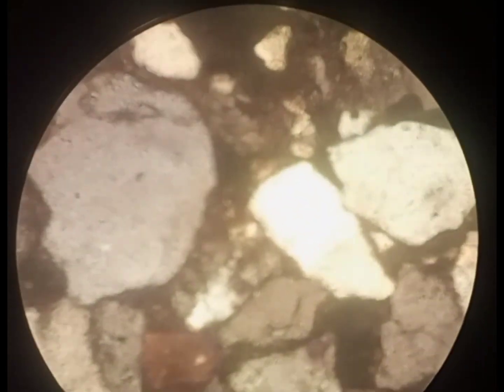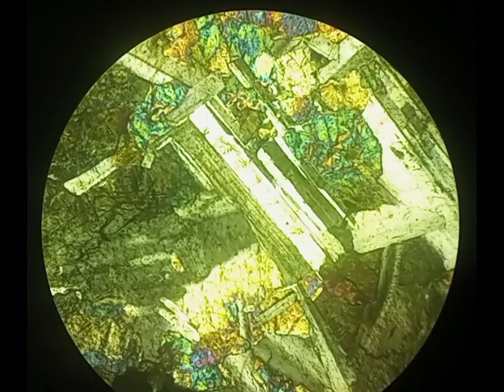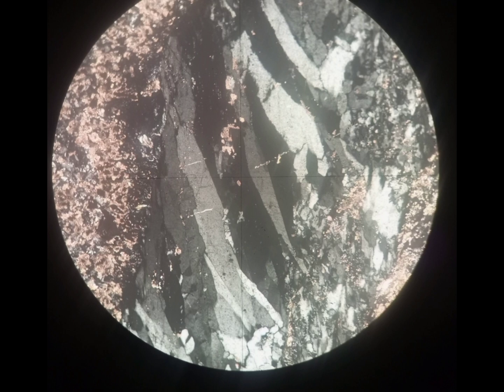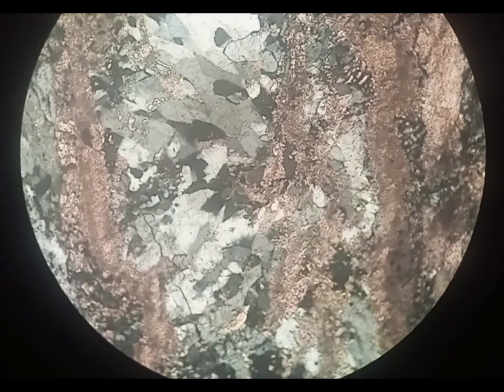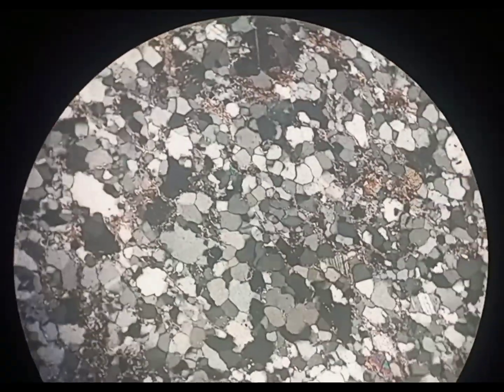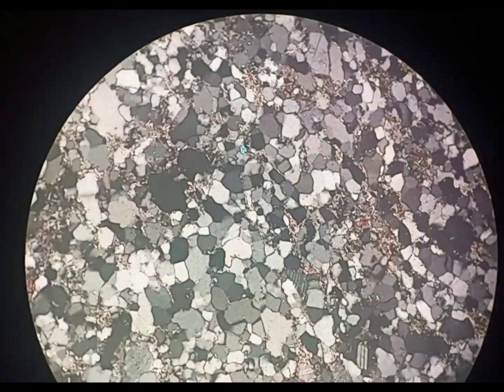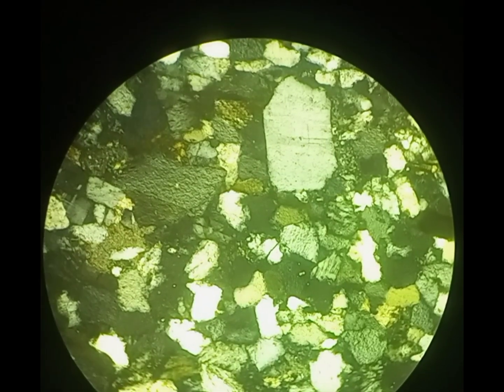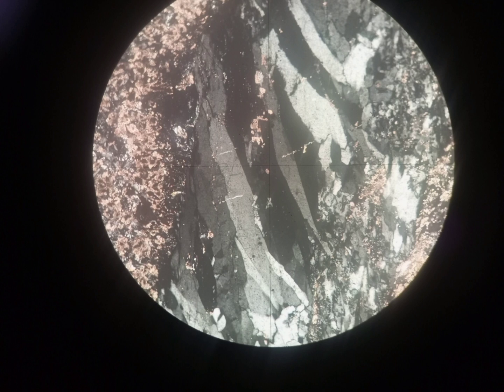Quartz grains are mostly found in anhedral to subhedral crystal shapes and are mostly rounded. On the other hand, feldspar grains are found in euhedral to subhedral crystal shapes. Crystal form and habit are also very important for identification. Quartz is mostly found in equant crystal form, while feldspar is found in tabular, elongated, acicular, and rectangular form — commonly referred to as feldspar laths.